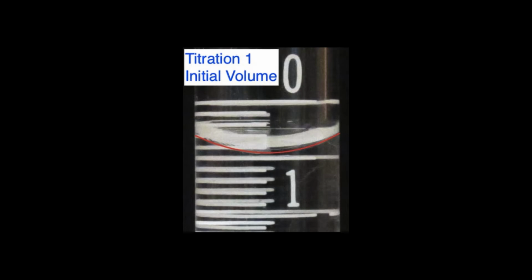Now notice how the Buret is laid out. It's different than a graduated cylinder, which we've all had experience with. You're starting at 0 milliliters up top. The volume is increasing as you go down. And what you have to realize is that each line there, as you're dropping down on the Buret, it's actually counting up on the volume. So again, each line you're going from 0 to that mark is 0.1 to 0.2 to 0.3 milliliters. And then 1, 2, 3, etc., which you can't see.